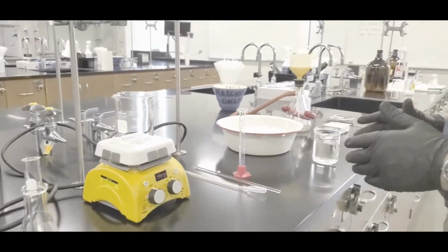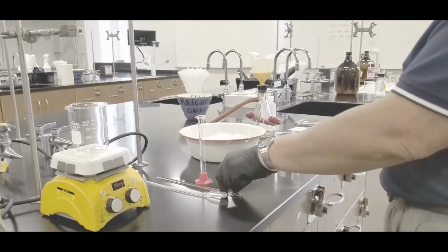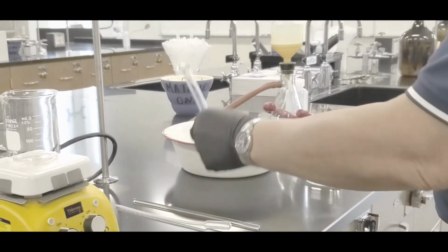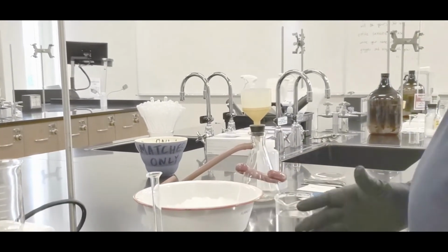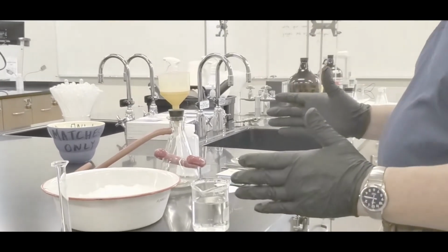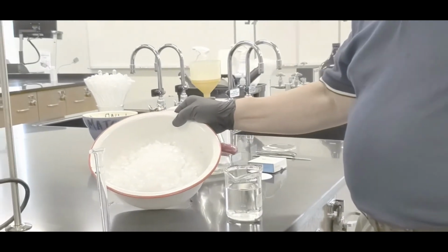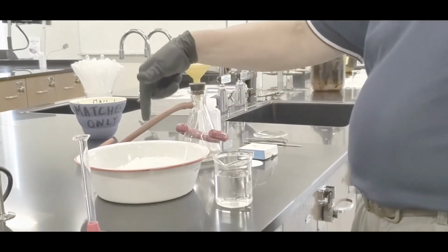Now the next part is for stopping the reaction. That's when you need a long stem disposable pipette, a stirring rod, and also a small graduated cylinder. Okay, this is for stopping the reaction. Now the next thing is to chill the product after you make it. So you have a tub full of ice. Go get some ice, and then later on you need to put some water in. Okay, so that way you establish the equilibrium.